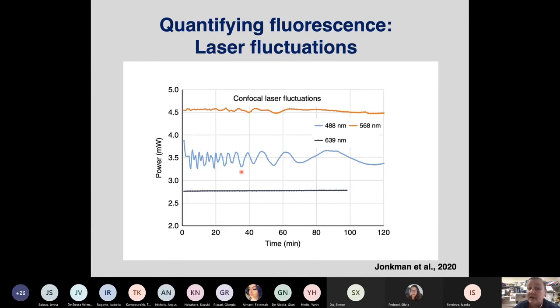Sometimes the quantification is marred by very, very unexpected problems. Now, this is a confocal microscope that lived in the Rockefeller imaging facility. And this was a pampered confocal microscope, checked all the time, and only run by expert staff. But what they eventually realized was that with the 488 nanometer laser, they had a bit of a problem with laser fluctuations over time. And it didn't necessarily matter how long the laser was running. And you can again imagine that if you measure your stuff here or you measure your stuff here, it may affect your numbers.